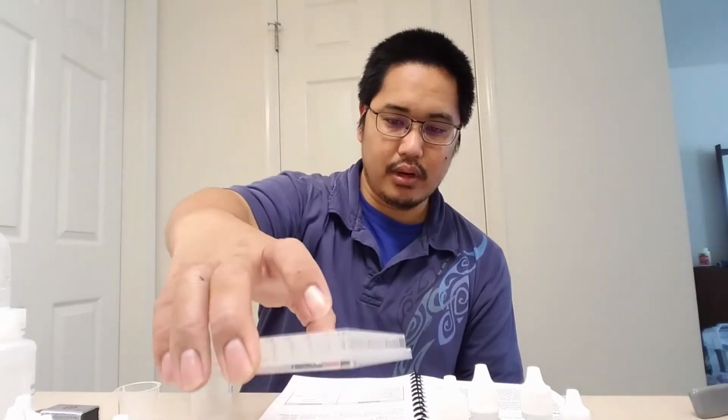So, the object of this lab is to gain an understanding of conductivity of liquids, to observe conductivity of solutions of salts, strong acids, and strong bases that have a high degree of dissociation. We need to observe the conductivity of solutions in weak acids or bases that have a low degree of dissociation, and we want to observe the conductivity of distilled water as it dissociates slightly, and also to observe the conductivity of organic solutions and an organic liquid.